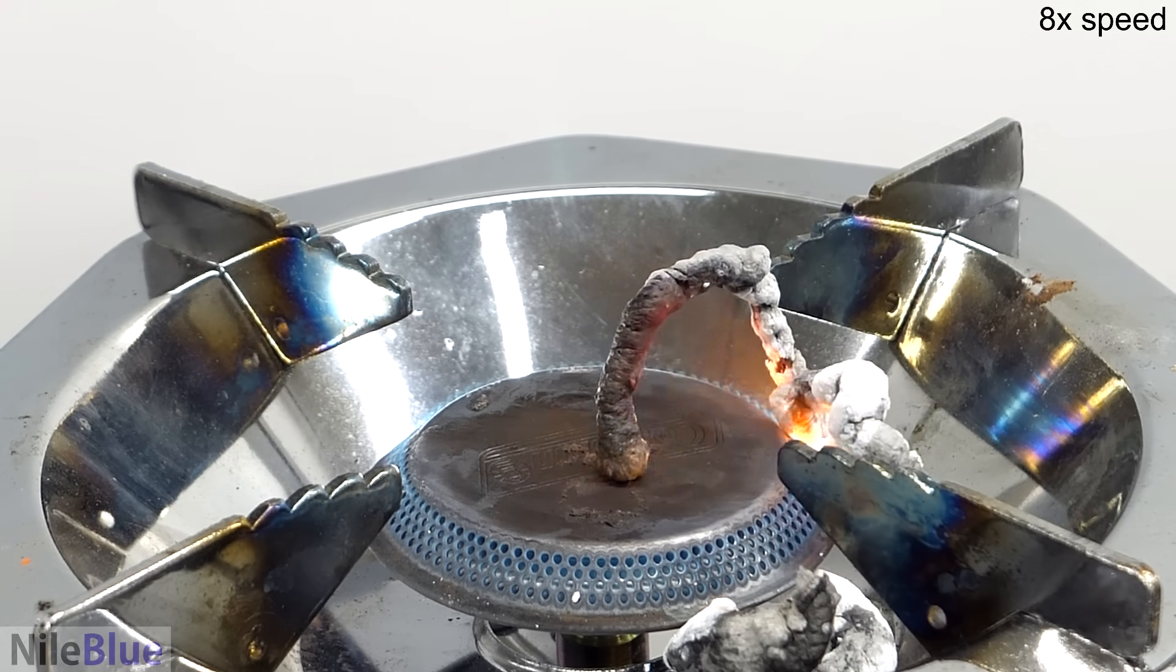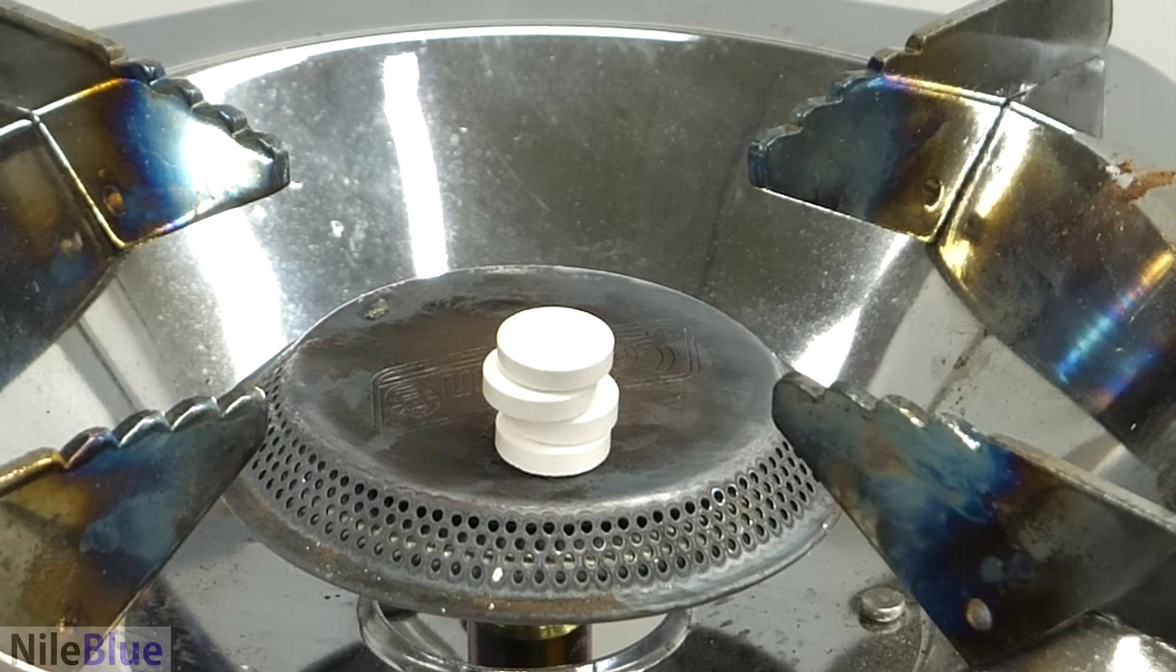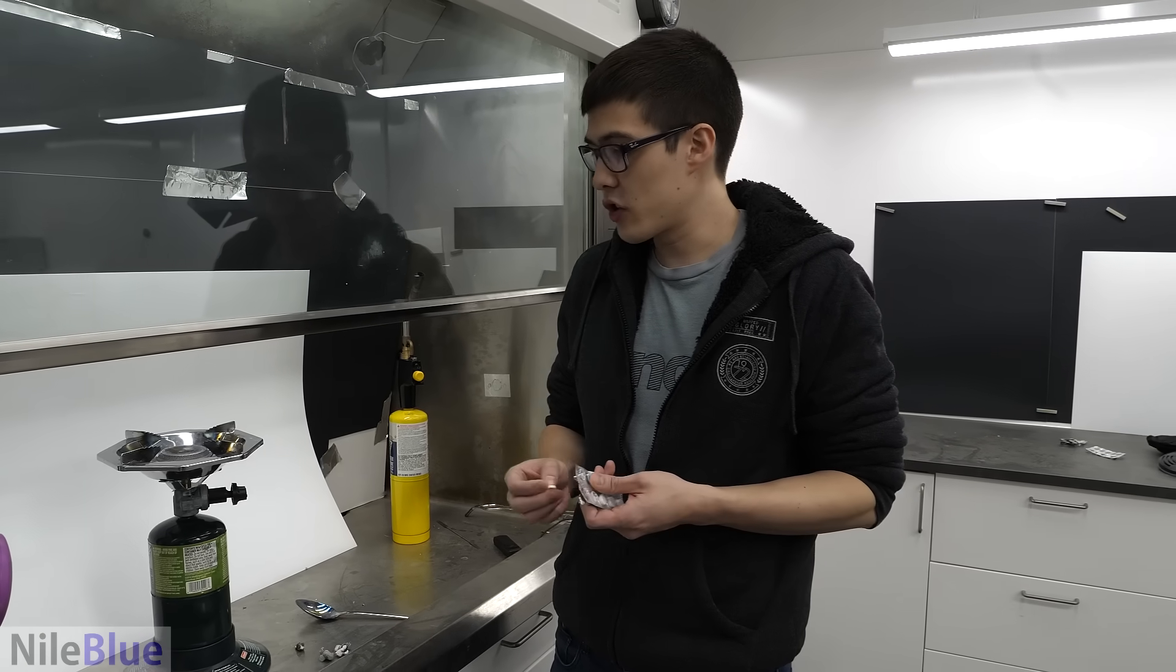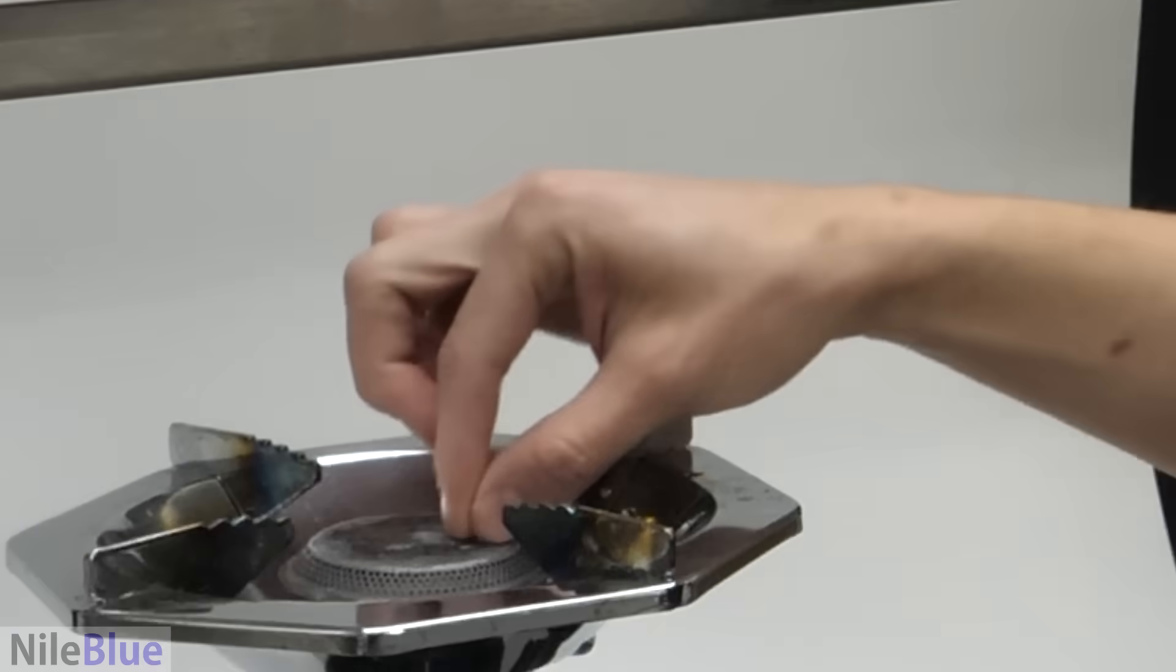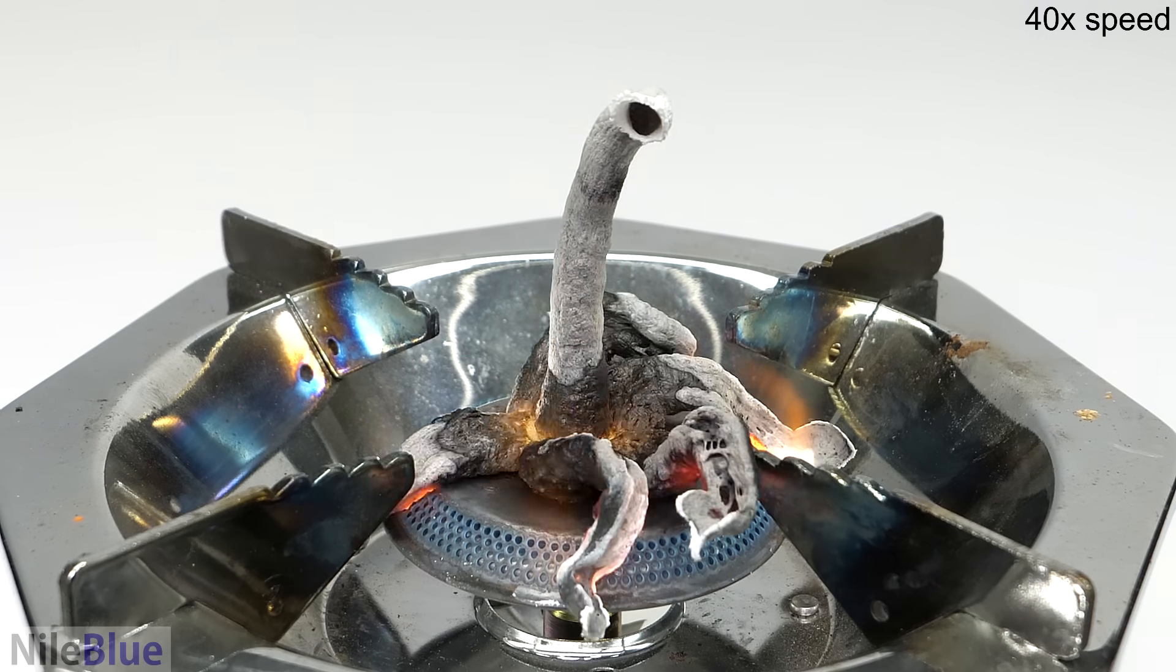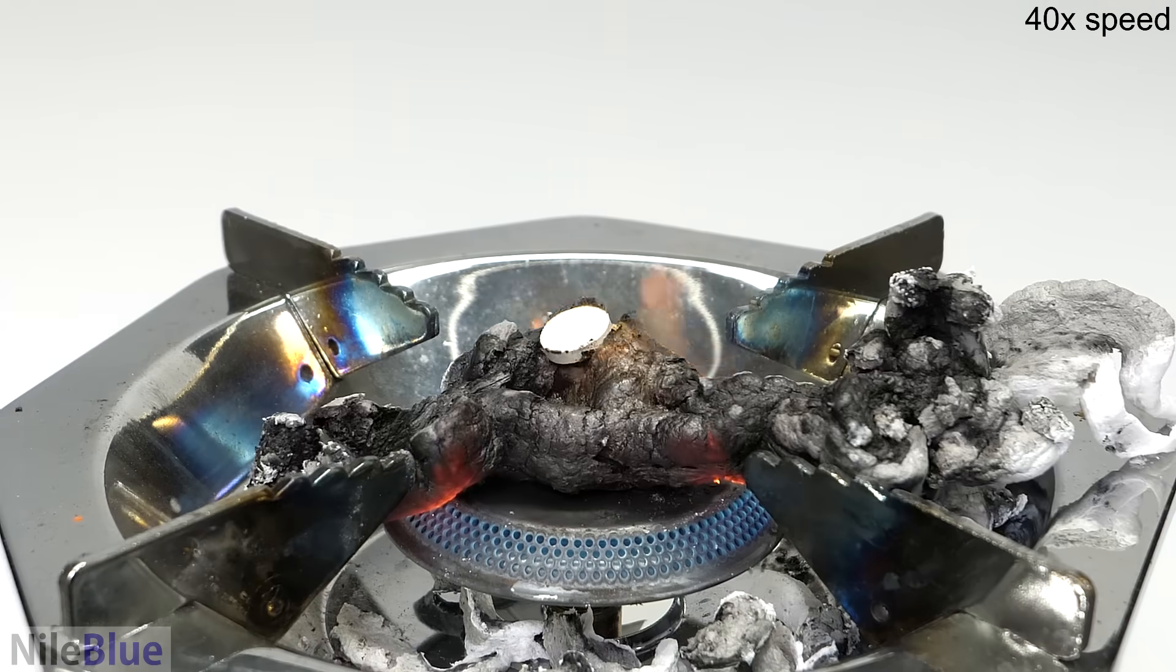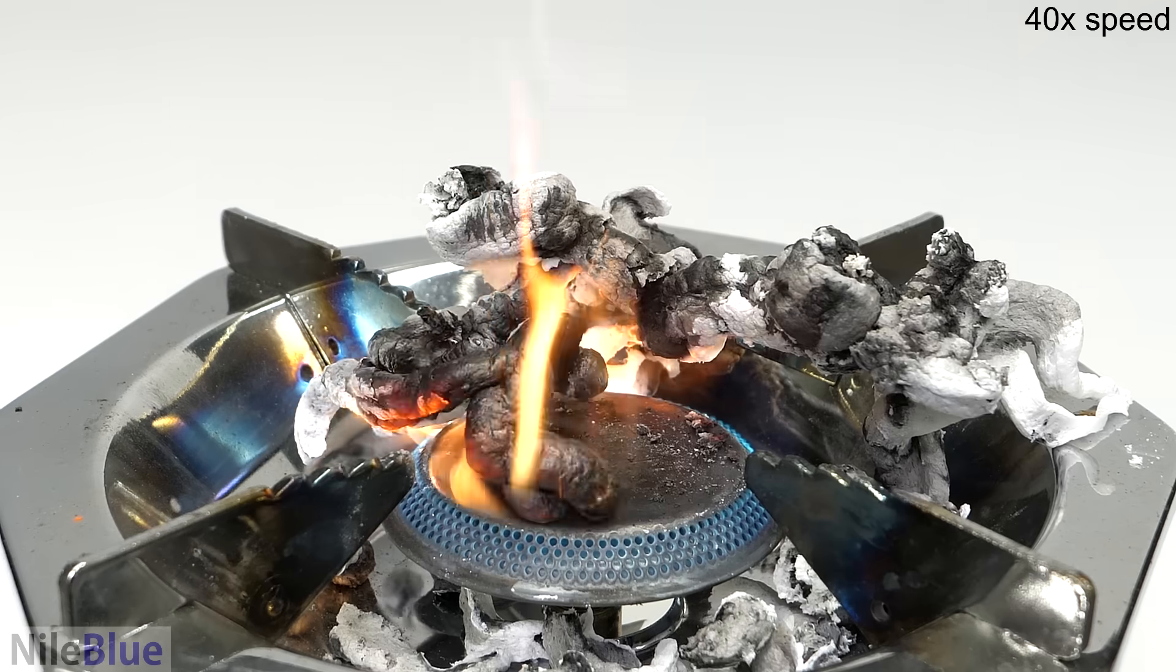Stacking them might be another thing to test. I don't think it works too well when you just put one of these, or it works okay when you just throw one of them on. But it's kind of small and lame. But then when you add more, it kind of just blocks the heat from the other one. And then maybe if it goes well, they all combine into one and then grow one thing. But it's kind of just a jumbled mess of a bunch of things all mixing together.